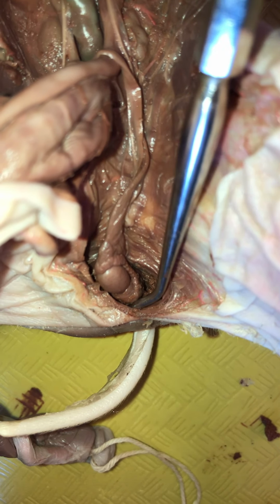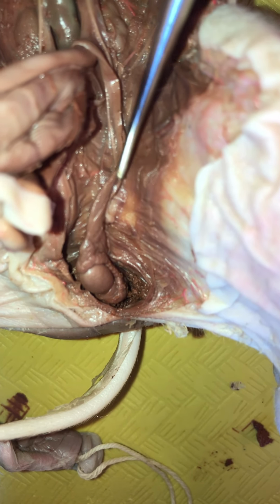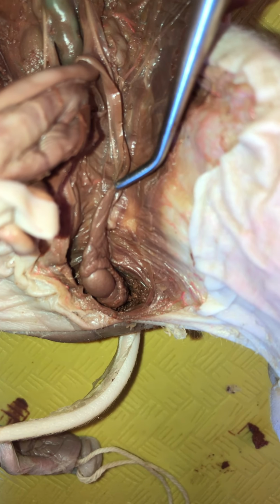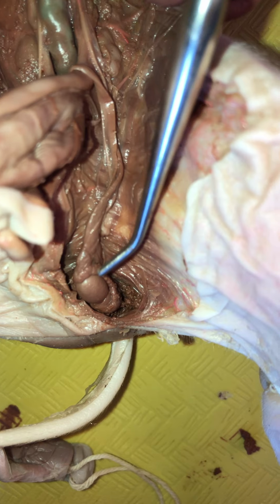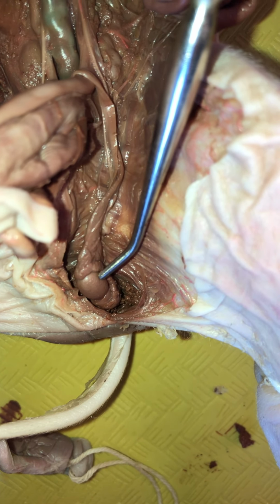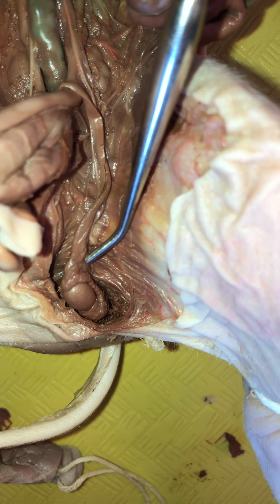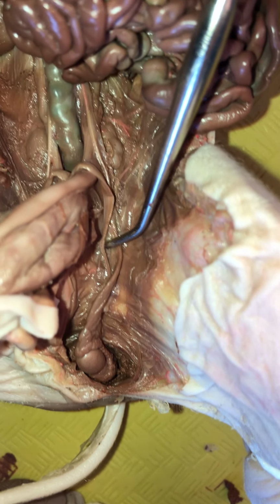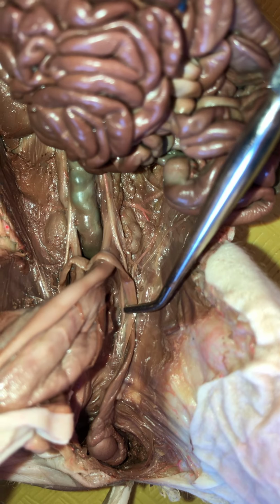So now we are in the scrotal sac, okay? You're really in the inguinal canal, so you can't see the opening or either opening, right? The external one or the internal one. So what are these structures? The testis makes sperm and hormones. The epididymis stores sperm. Okay, and then you're going to see this tape-like structure that we were seeing before. So that's the vas deferens, or the ductus deferens.